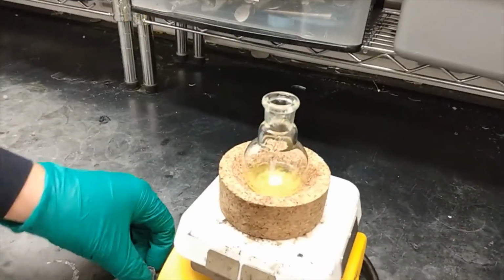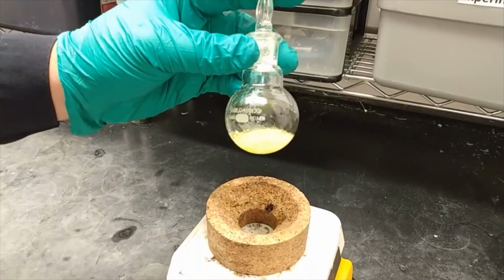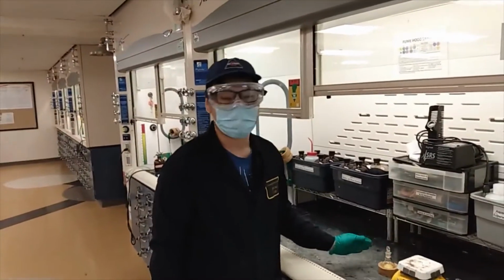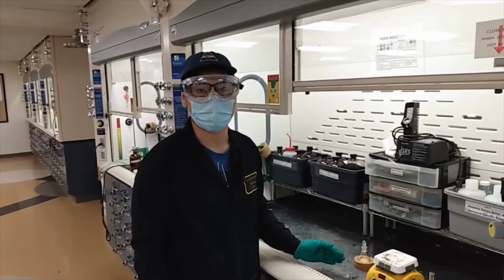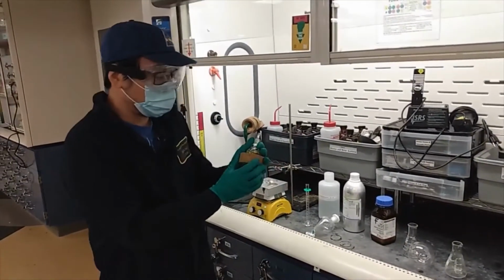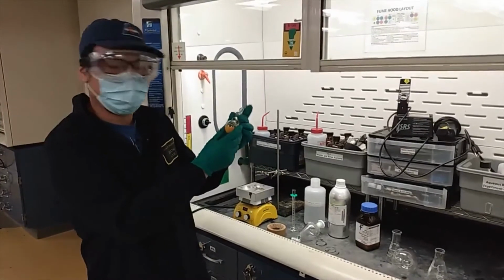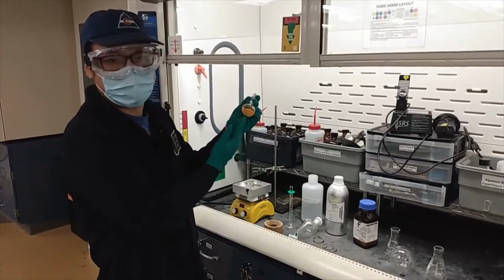And you can see the color starting to become orange-ish, and we will let it sit for 4 to 7 days to let it fully react. And after the 4 to 7 days, we will work up the reaction. After like a week of waiting, we can find the product has become orange-ish. So what we are planning to do, we will extract the product through these chemicals here.